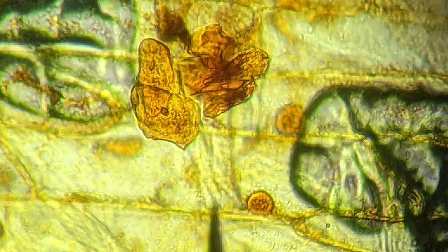We have a lot of really cool measurement tools for eukaryotic cells, but we're also going to do another technique that'll help us measure prokaryotic cells — and for that we're going to use yogurt.